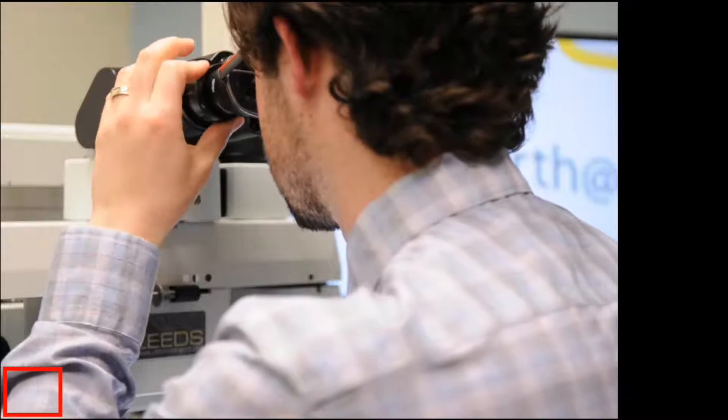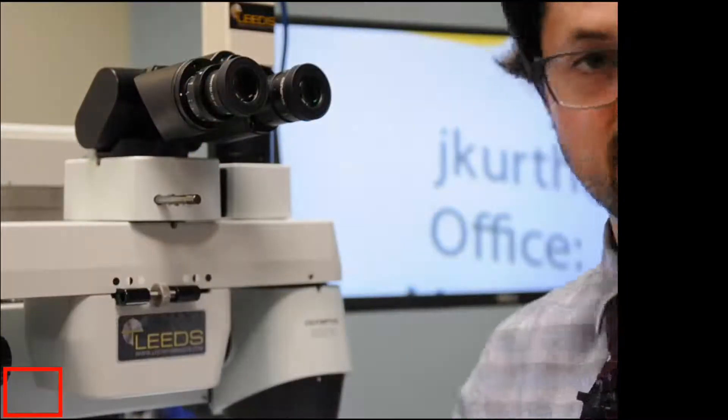So then I'm going to do the same for my left eye, just to bring the image into focus, and that's the technique.